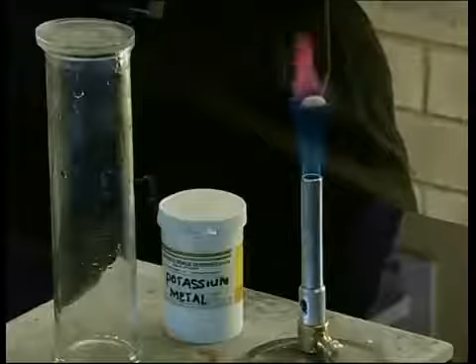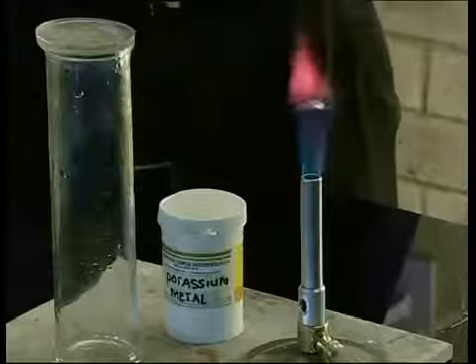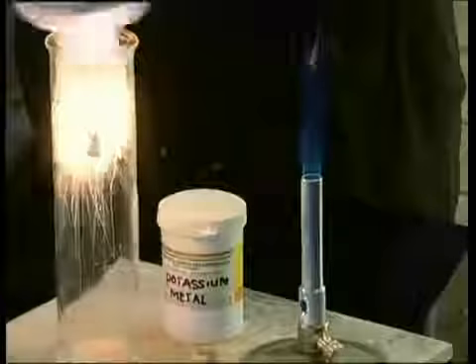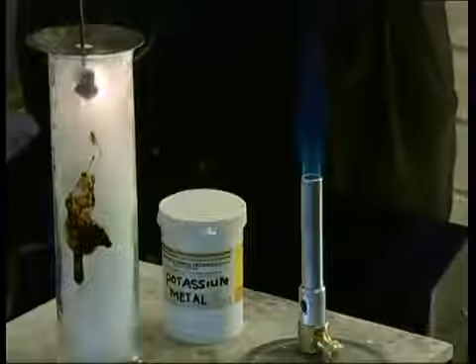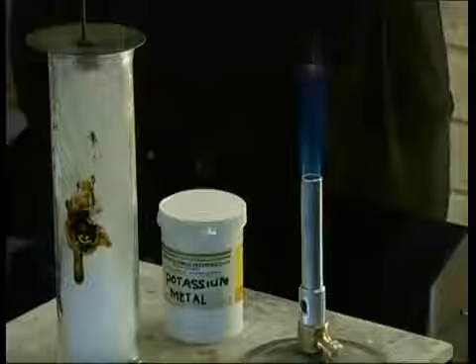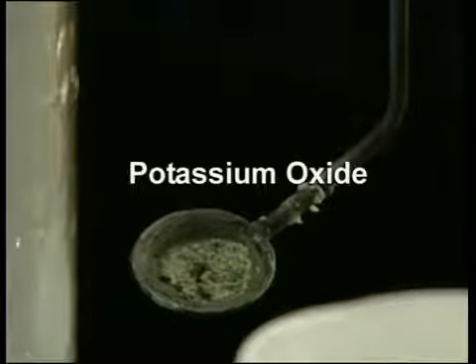Now we try potassium. Potassium burns with a beautiful lilac or purple flame. The lilac flame is much brighter when potassium burns in pure oxygen, and the reaction is more vigorous. Again, the product is a white powder that will be kept aside for further tests. The name of the product is potassium oxide.